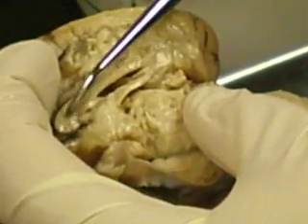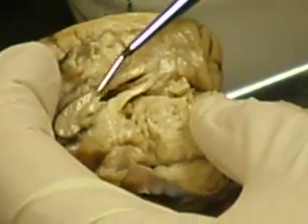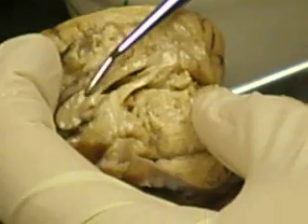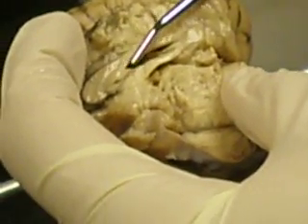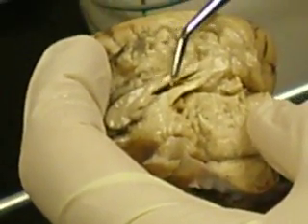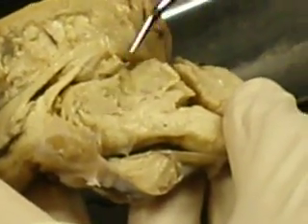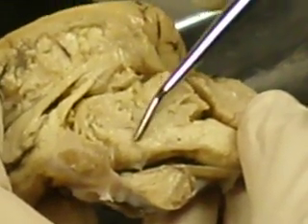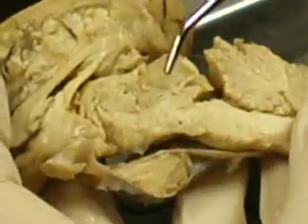This large, light structure is the corpus callosum. The fornix is this one right here — kind of hard to differentiate on this one. Right here would be the thalamus, and underneath it would be the hypothalamus.